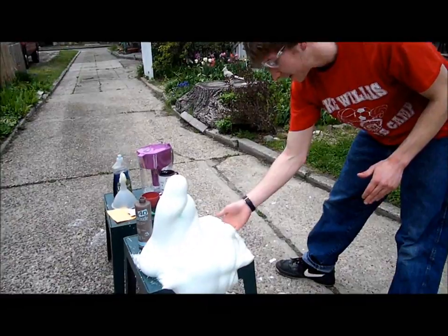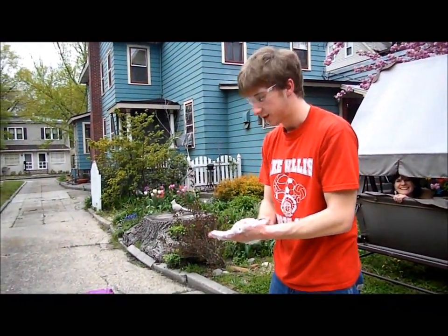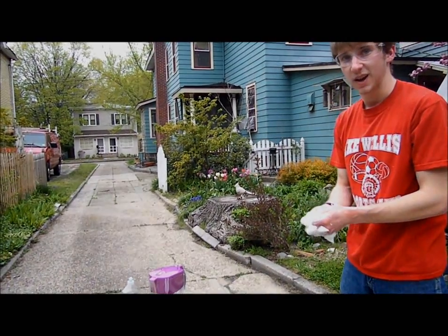And it's a little hot, but you can actually pick it up, and it's pretty much foam, soapy foam. So what you might clean your dishes with or something like that. So that's our reaction, and I hope you enjoyed it.